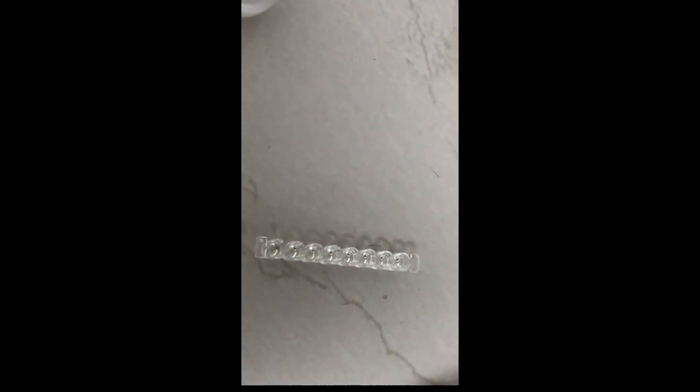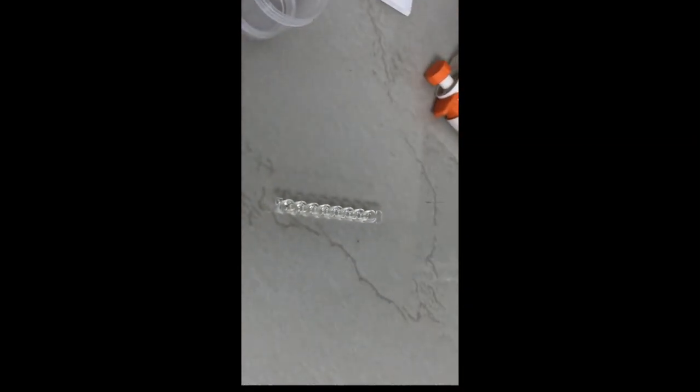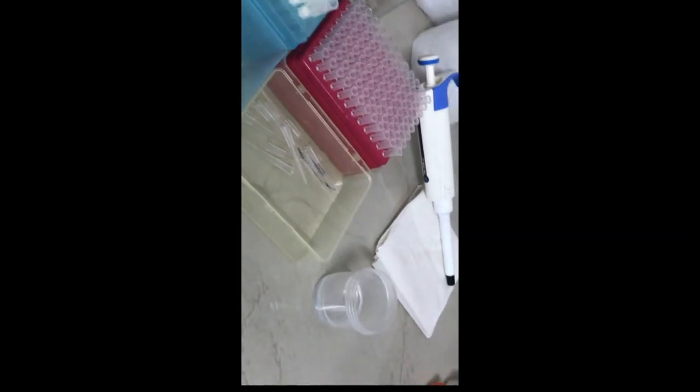Now we will again incubate these wells for 15 minutes at room temperature. We will keep it in the incubator at the room temperature.